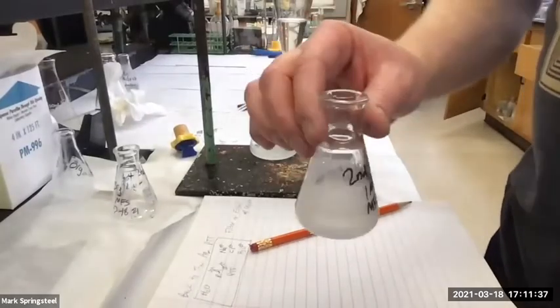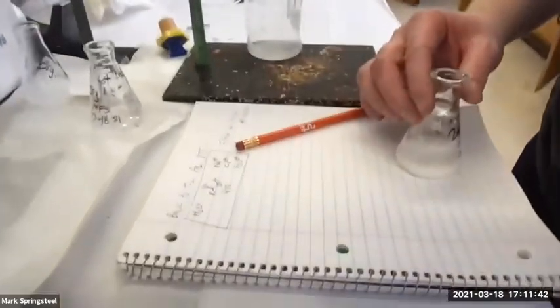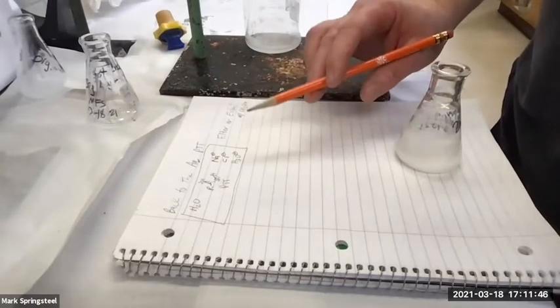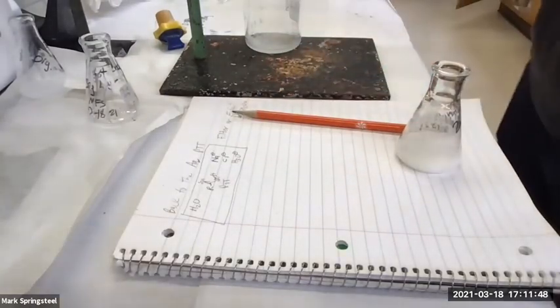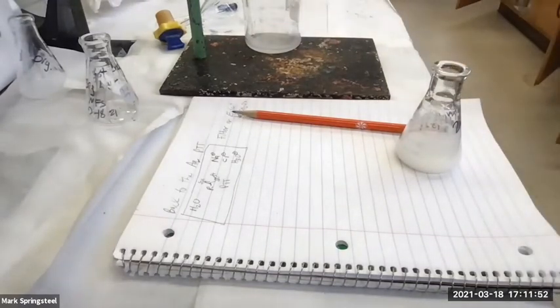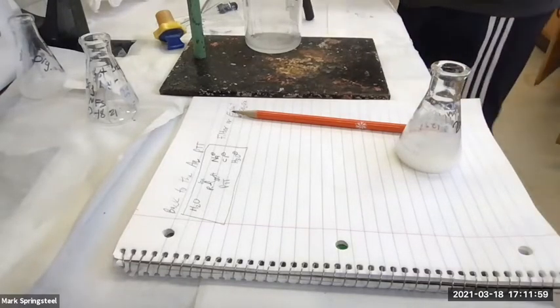So we have our precipitated carboxylic acid in here, and we want to separate it out from the water, sodium chloride, hydronium. So we're going to do a filtration. So we'll do a vacuum filtration. Let's set that up just like we did last time. I have a water trap bottle here that is already attached to a ring stand, so that makes it convenient.